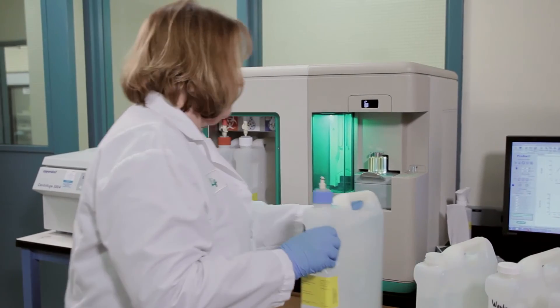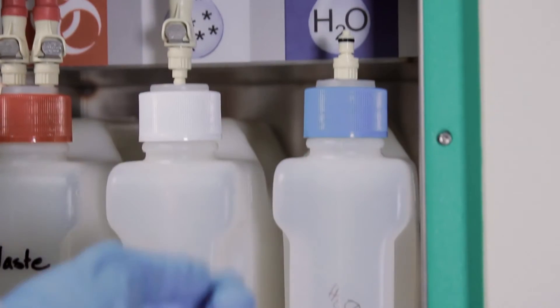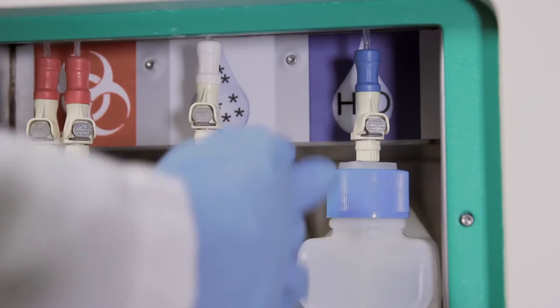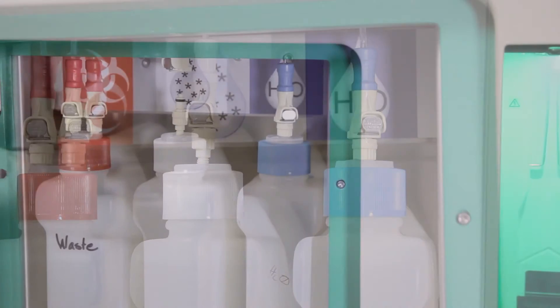Place the new container in the appropriate position and attach the quick disconnect to the cap assembly. You should hear a click as it connects. If you don't hear a click, press the metal tab to reset the quick disconnect and attach again.